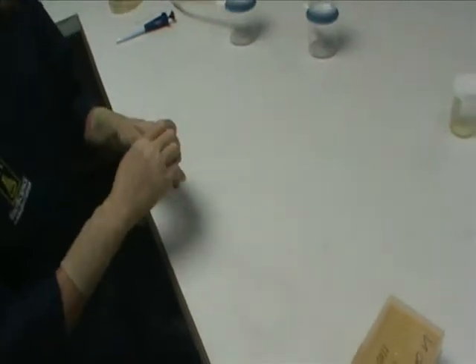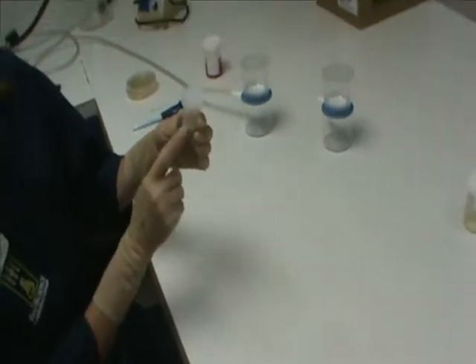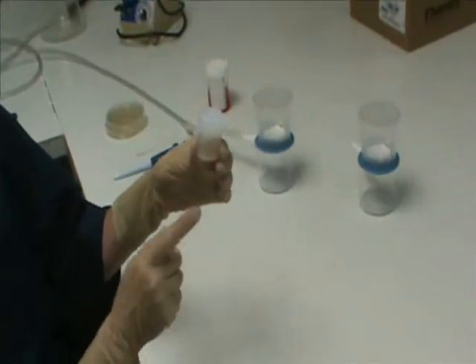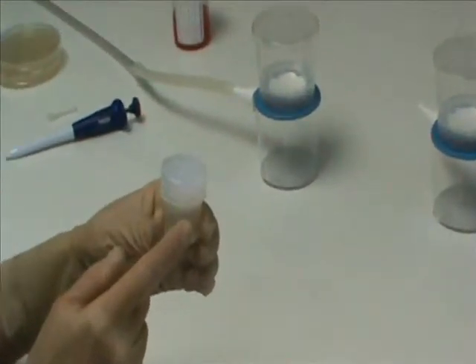The container is sealed and agitated for no less than one minute and sonicated as necessary to remove the dried spores. The product is completely neutralized at this time.